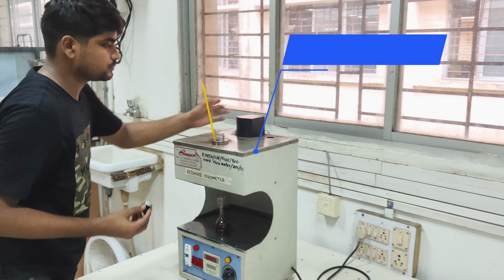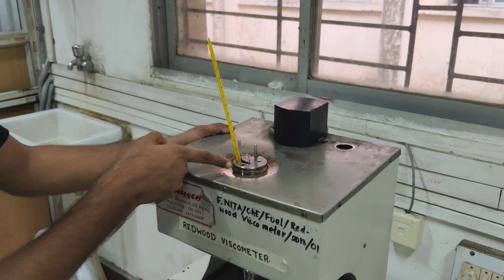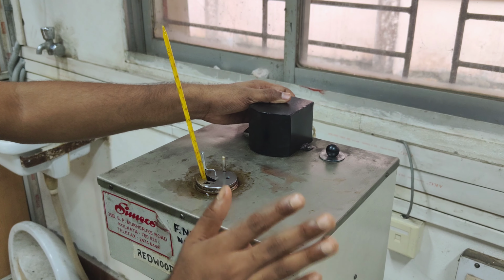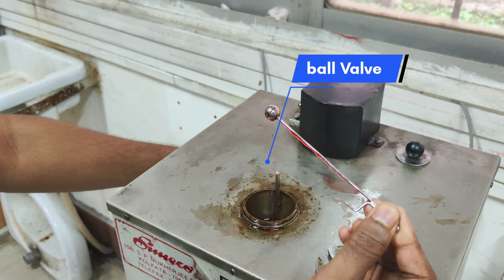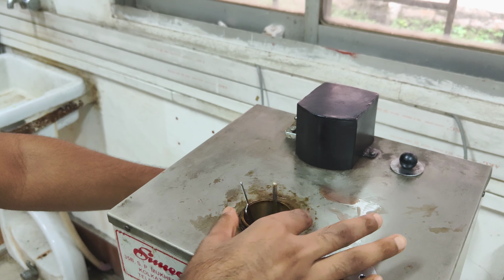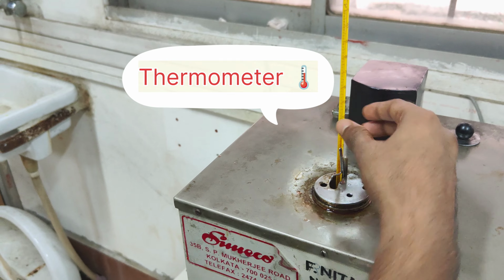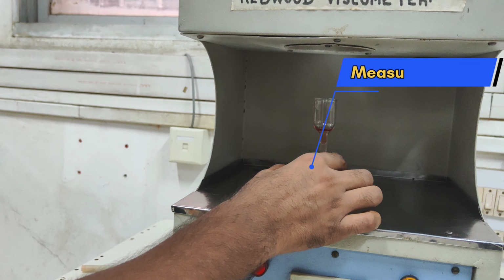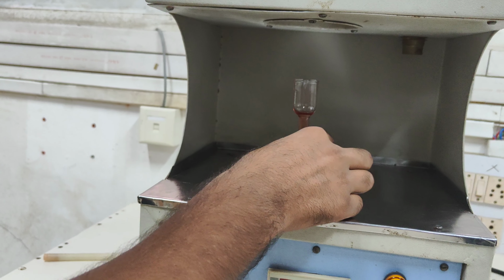This is the water bath. Here there is water by which we increase the temperature and reach the desired temperature of the bath. This is the stirrer, by which uniform temperature is maintained everywhere in the water bath. This is the ball valve, by which we close the orifice and start the experiment. This is called the oil cup. With the help of this thermometer we measure the temperature of the given sample. Now this is called the measuring flask. Here we have to collect the 50 centimeter cube, that is 50 ml, of the given sample up to this mark.